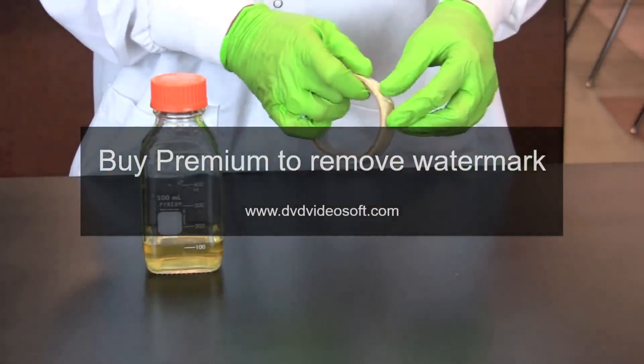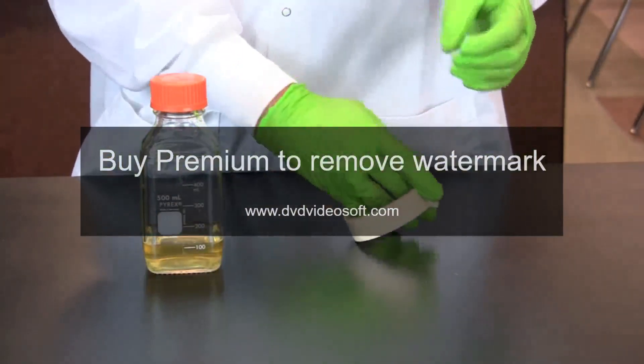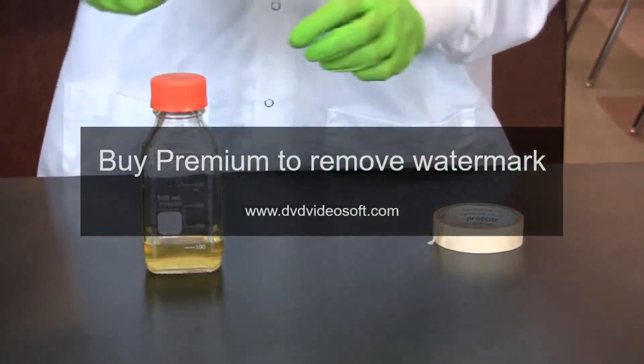When the medium is clear, put a piece of autoclave tape on the lid of the container, ensuring that the lid is loose. Then place the container into the autoclave.